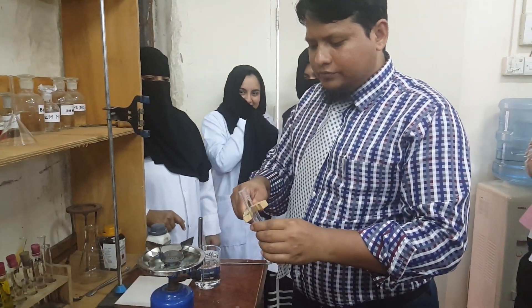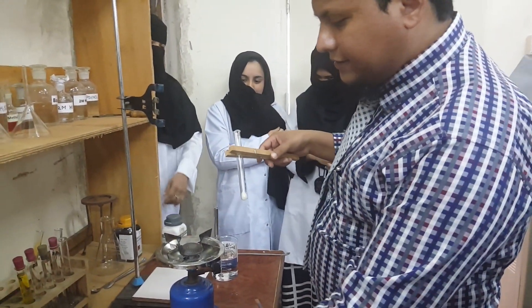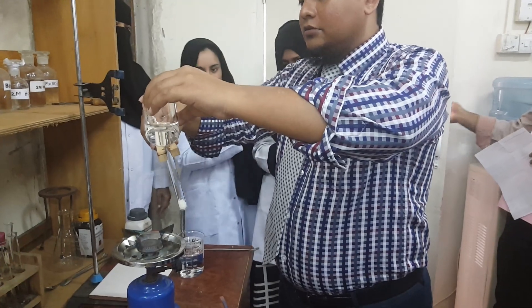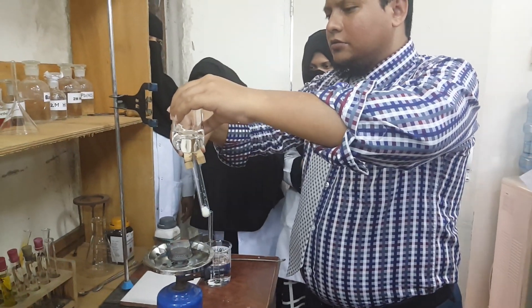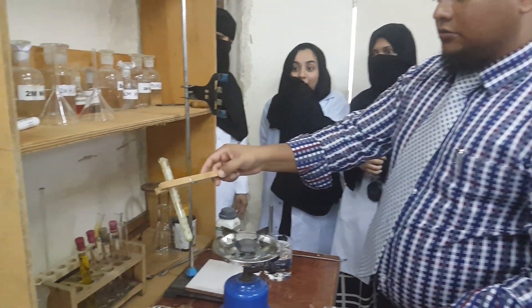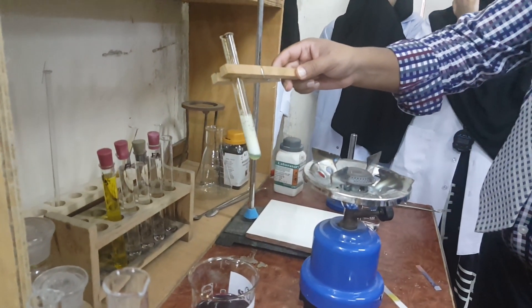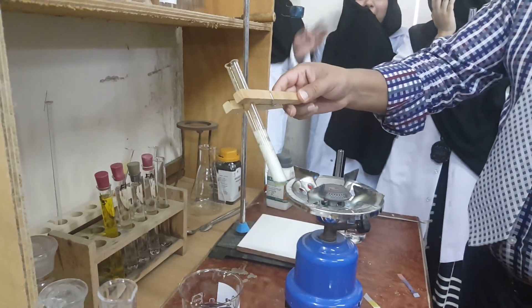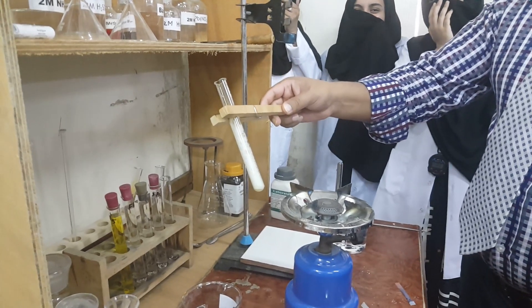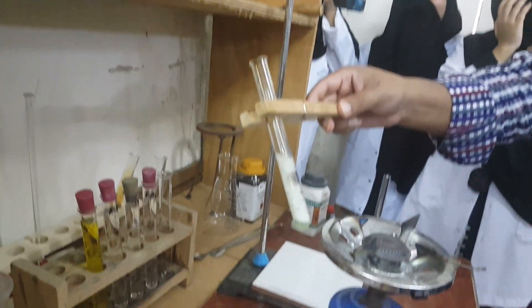It will form — here you have HCl, right? Have a look at this. What is this gas? Brown gas. Look at the brown gas.